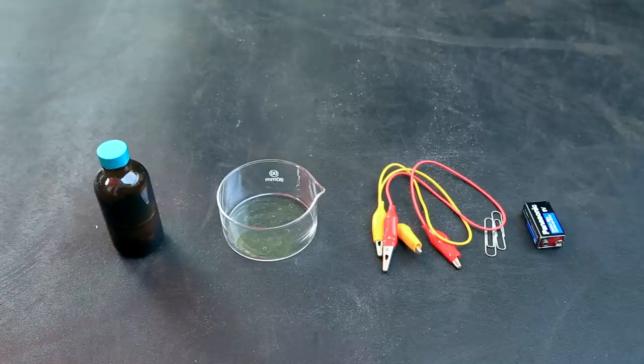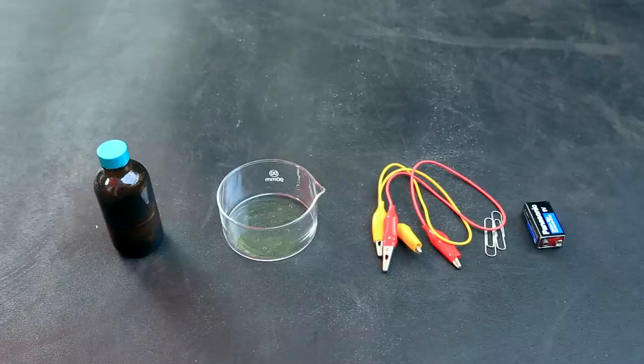So this is basically what you need to carry out this experiment. You need a stannous chloride solution, a dish to hold it in, some alligator clips, some paper clips, and a power source.